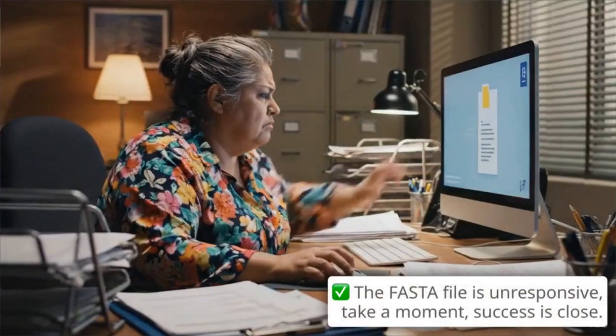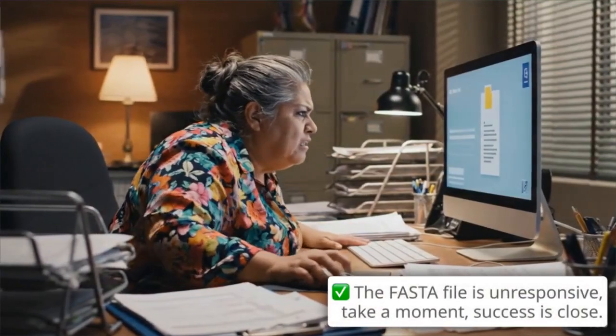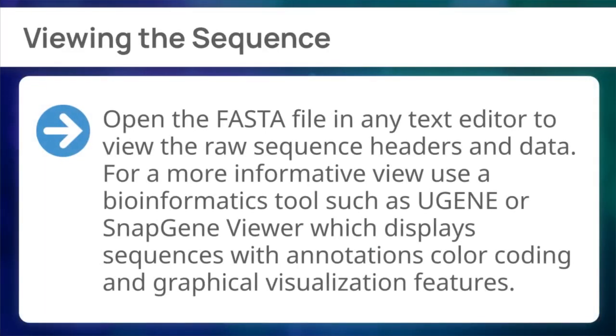Let's quickly pivot and execute these 3 targeted actions to find the core of the problem. First, viewing the sequence. Open the FASTA file in any text editor to view the raw sequence headers and data. For a more informative view, use a bioinformatics tool such as UGENE or SnapGene Viewer, which displays sequences with annotations, color coding, and graphical visualization features.